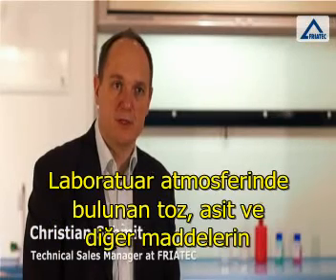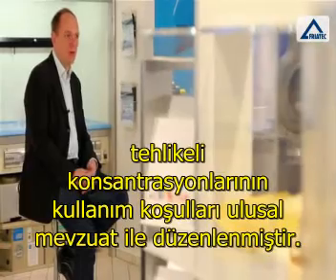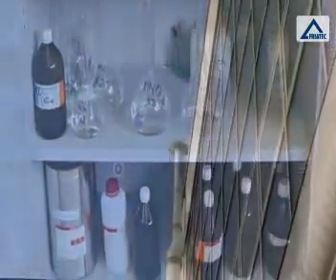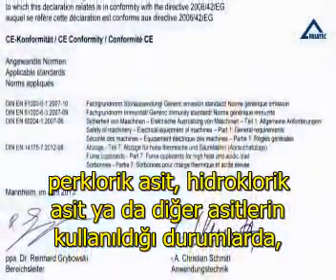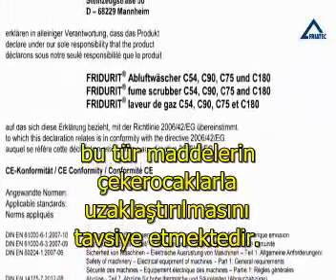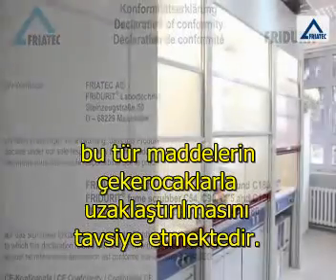National regulations govern the handling of dangerous concentrations of dust, acids, and other substances coming out of the air in the laboratory. For example, in Europe, EN 14175 Part 7 recommends the handling of such substances in fume hoods if you use perchloric acid, hydrochloric acid or other acids, for example.